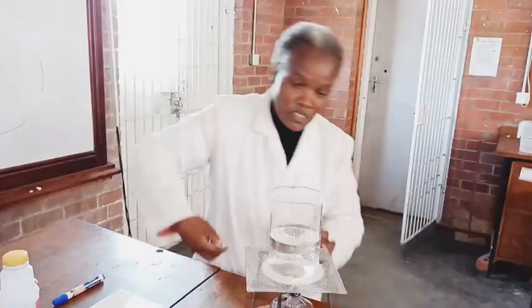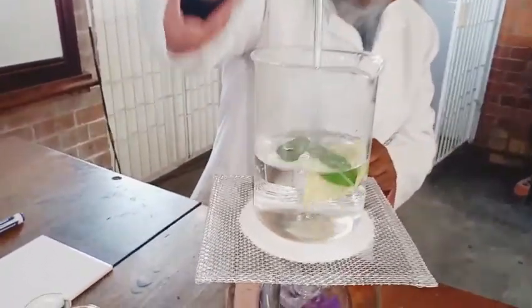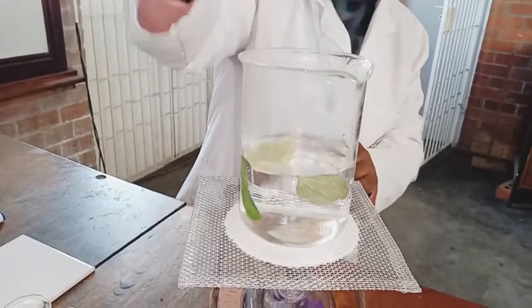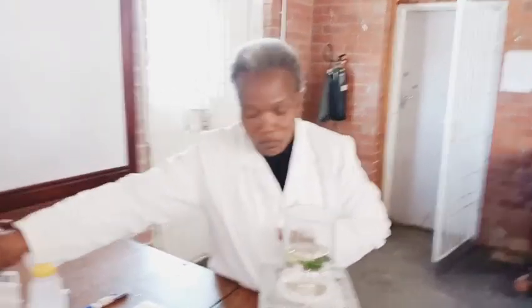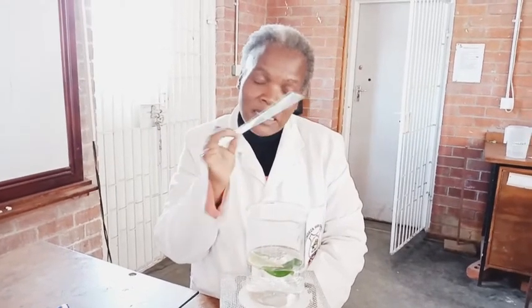So we are going to do the steps. First we are going to dip these leaves in water. We have created a water bath - this water has been boiled. We are going to dip these leaves in here for a few minutes. This first dipping is to stop all chemical reactions - we are going to kill the cells. When we say we kill the cells, we have destroyed the enzymes. The process is referred to as denaturation. This process also breaks the cuticle, as all leaves have a waxy layer which is waterproof. This will break that cuticle so that the reactions which follow can take place more correctly.